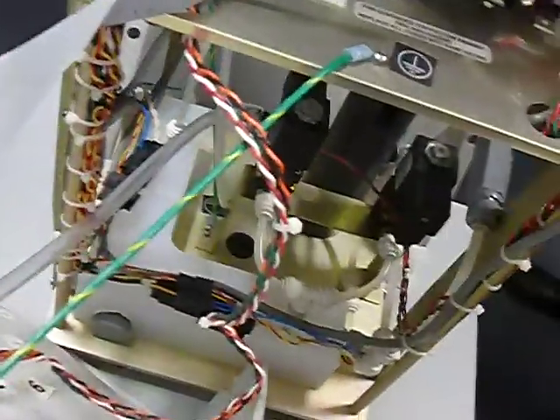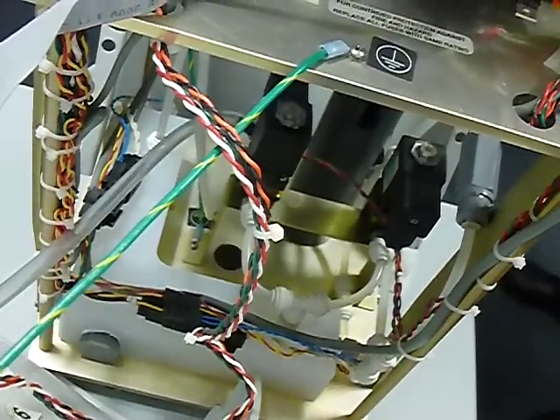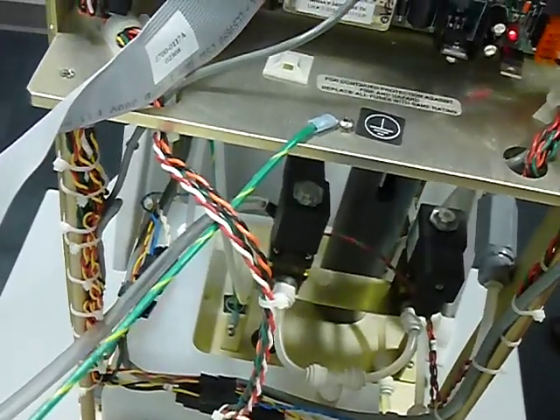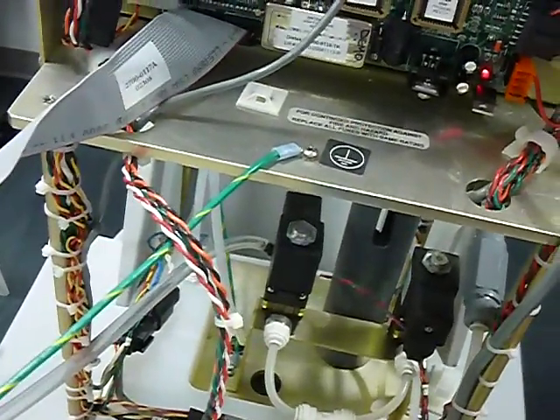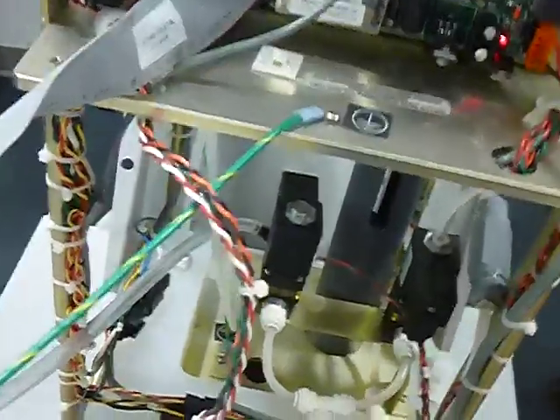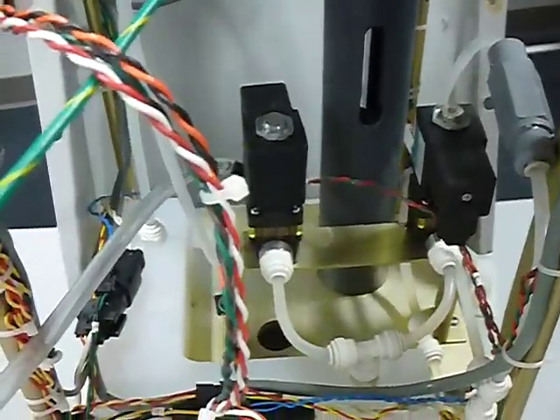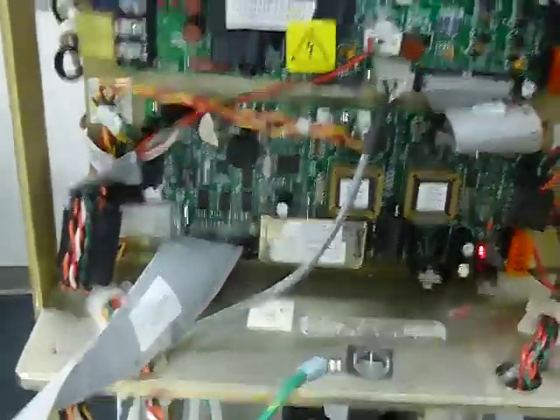This is different than before. I know that on the first one it was like in series. Yeah, there were 110 volts for 220, but they were connected in series. Oh, okay, yeah, on the first ones, maybe, they could have been. I don't know how they're doing it now. Now they're independent. Independent, okay?